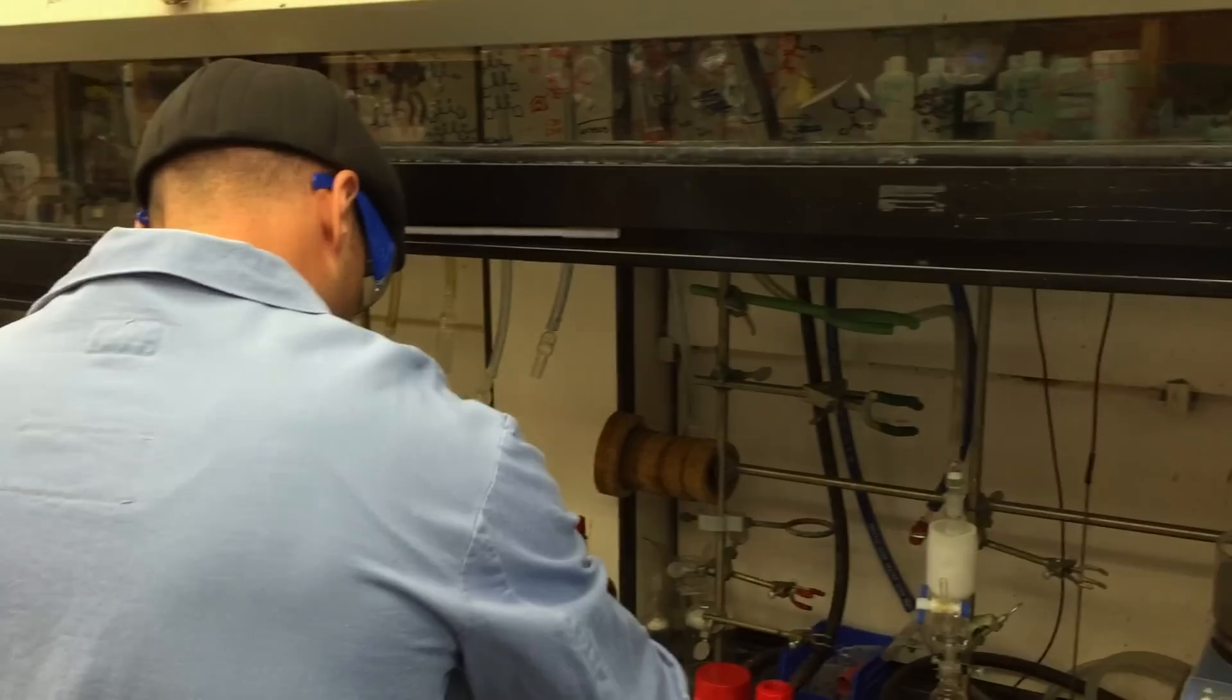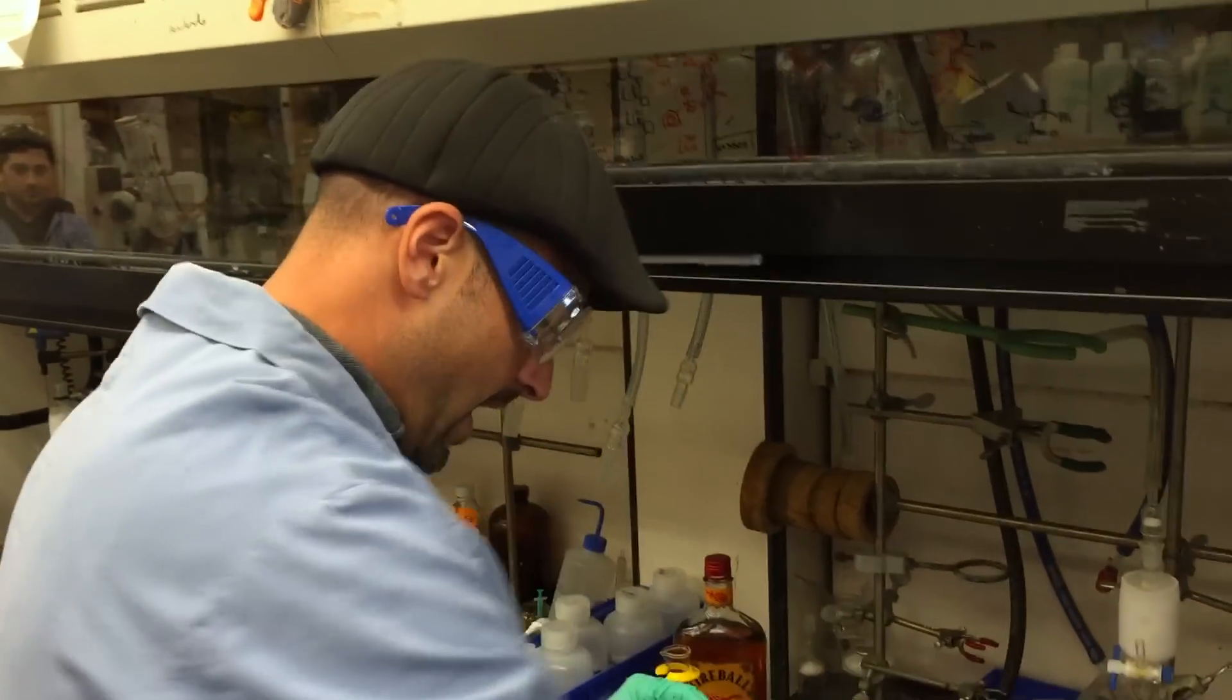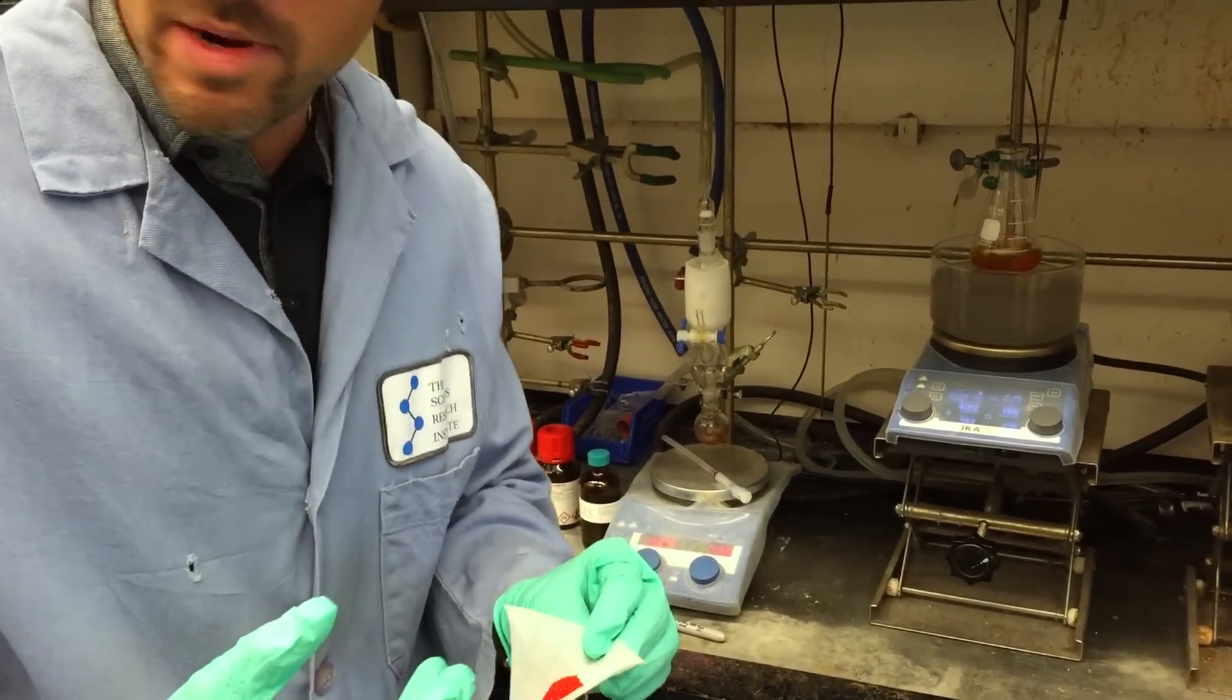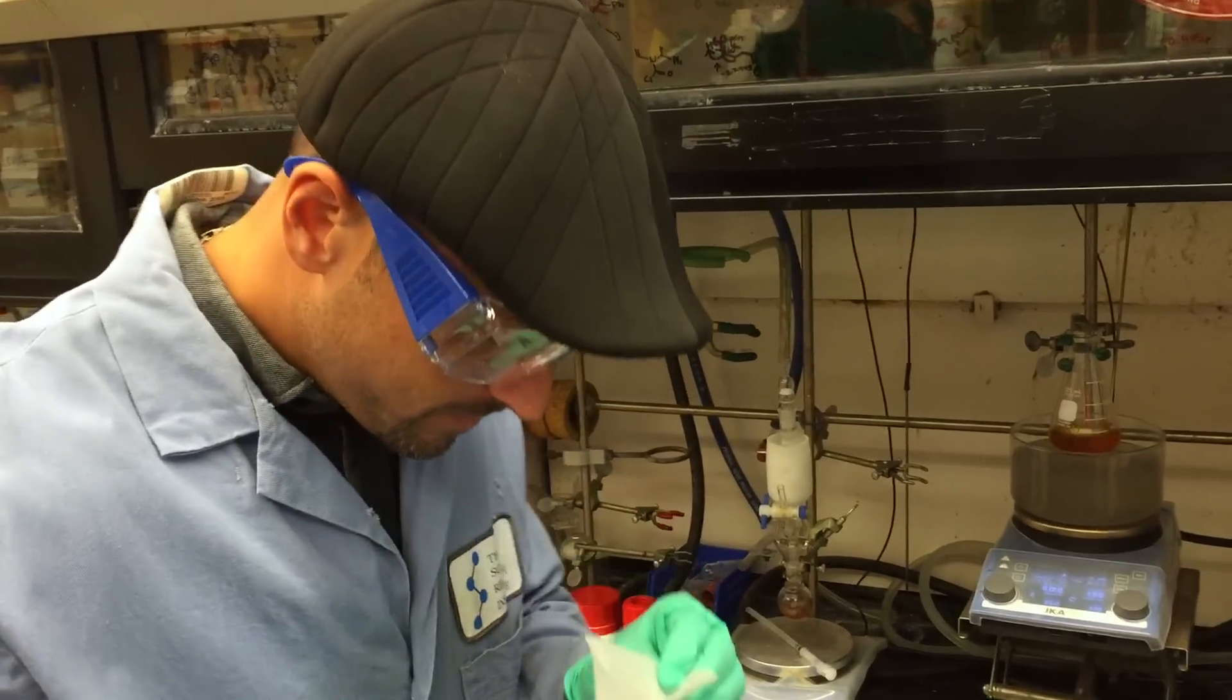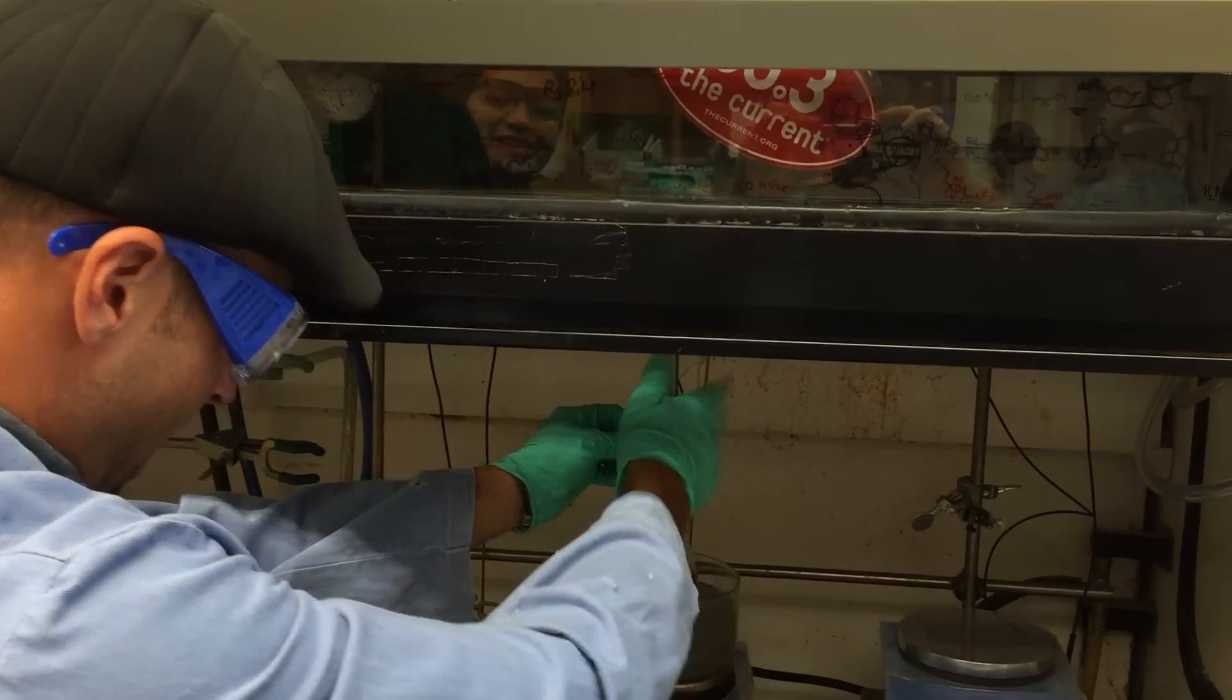Next, we're going to add the catalyst. The catalyst is very pretty. Julian made this with his own hands. You see it shimmers. It kind of actually smells a little bit. You might have a little bit of the ketone in there still. Okay. There goes the catalyst.